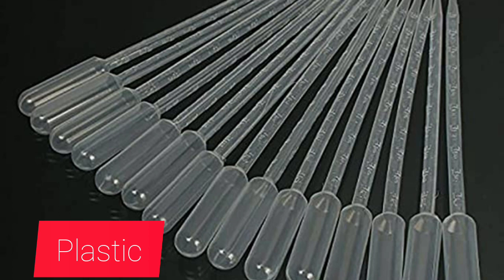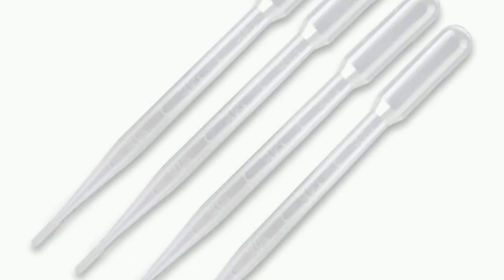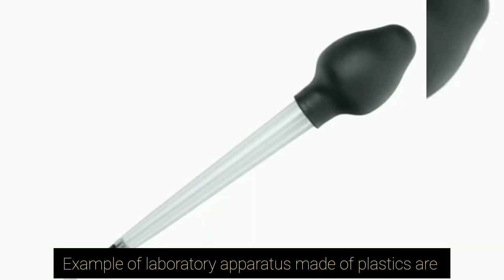Now let's look at plastic. I believe you're not surprised that I say plastic. Some of the chemistry apparatus are also made with plastic material, such as polyethylene or polypropylene. They are widely used in production of laboratory apparatus because they are not affected by water, alkalis, or dilute acid, but are readily attacked by organic solvents.